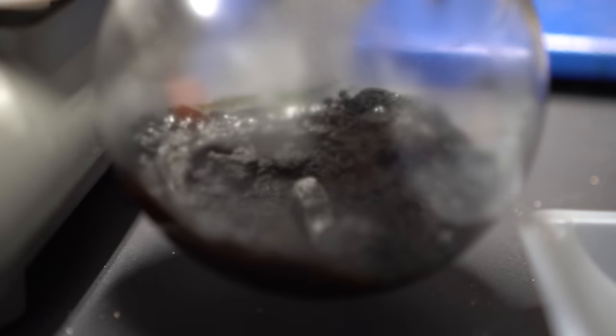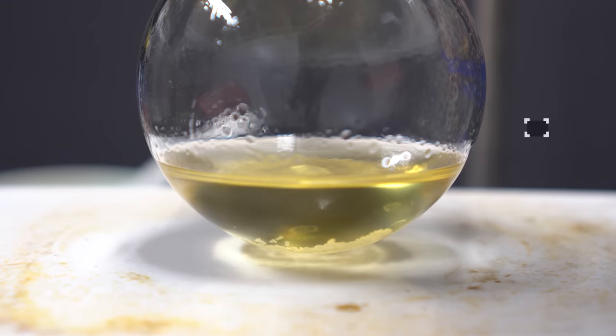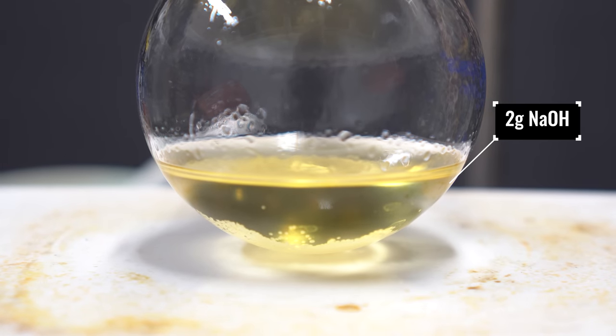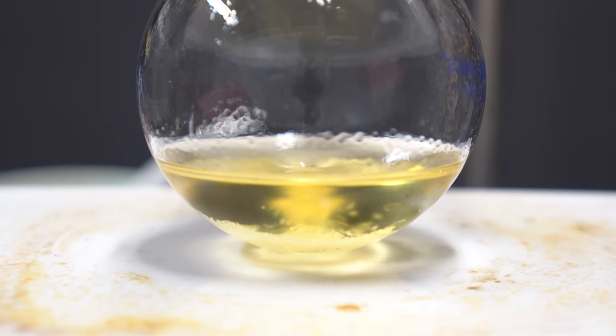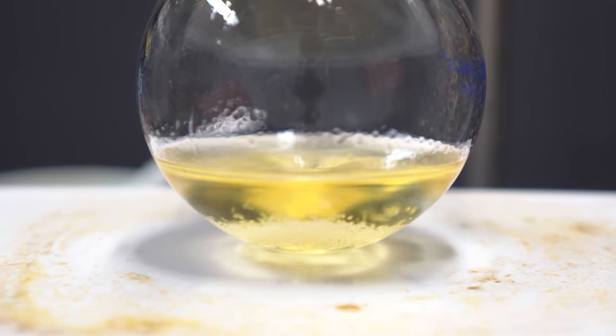This is our tar pit looking reaction flask, and it looks pretty terrible. I am not going to be happy to clean this. Before I set up for another distillation, I actually added 2 more grams of sodium hydroxide. I really wanted to see if anything would react if I added more, but nothing ever did. And the additional 2g addition will help with drying.